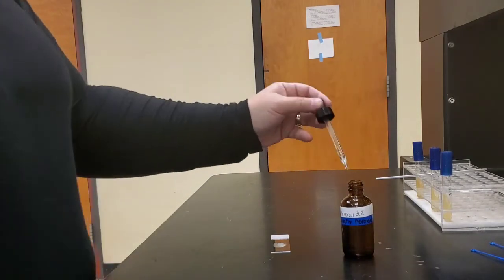When we do that, we can see that bubbles are produced when we add the hydrogen peroxide to our smear of Micrococcus luteus. These bubbles are produced as catalase breaks down the hydrogen peroxide and produces water. So that's one byproduct of the breakdown of hydrogen peroxide by catalase: water. And the second product is that of oxygen.